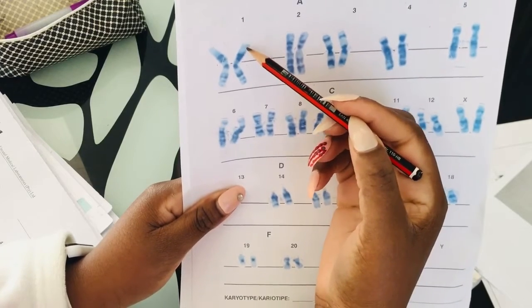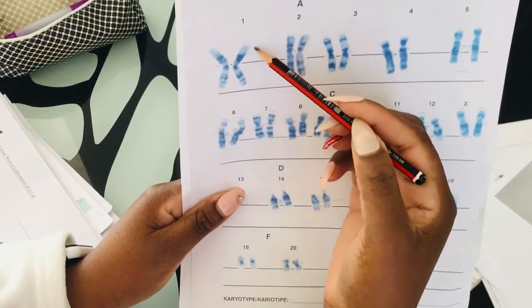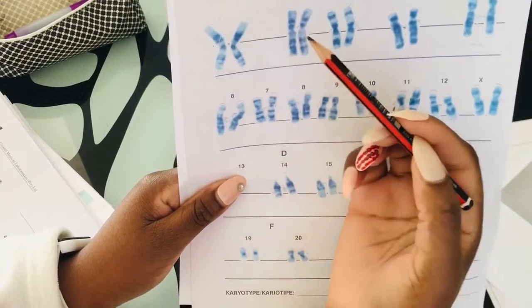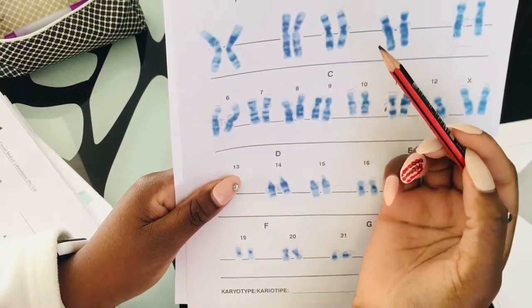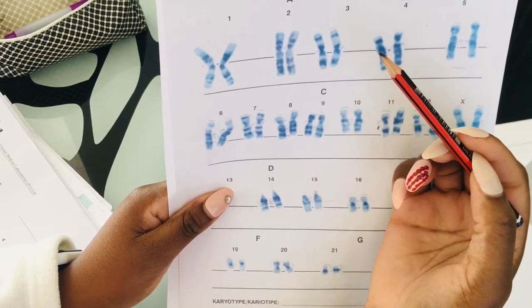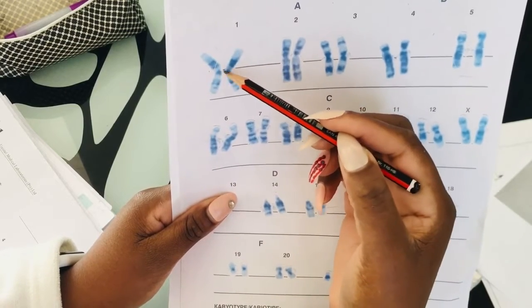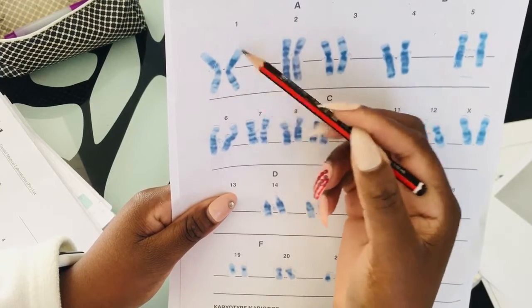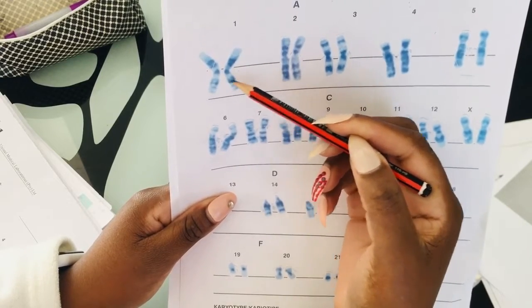So chromosome 1 has this fluffy beginning. You see, it's going to be your longest. Also, you're going to recognize it because you're going to see this fluffy beginning here. And then you see your centromere, it's centrally located, and this dark band here will give you an indication of your chromosome 1. I don't want to explain too much, but I fear that you may get confused, so we're just going to keep it low-key, a little bit simple. Okay, you have an idea: this fluffy beginning, and the centromere is centrally located. This is your metacentric. The centromere is in the middle, and then we have this dark band here.